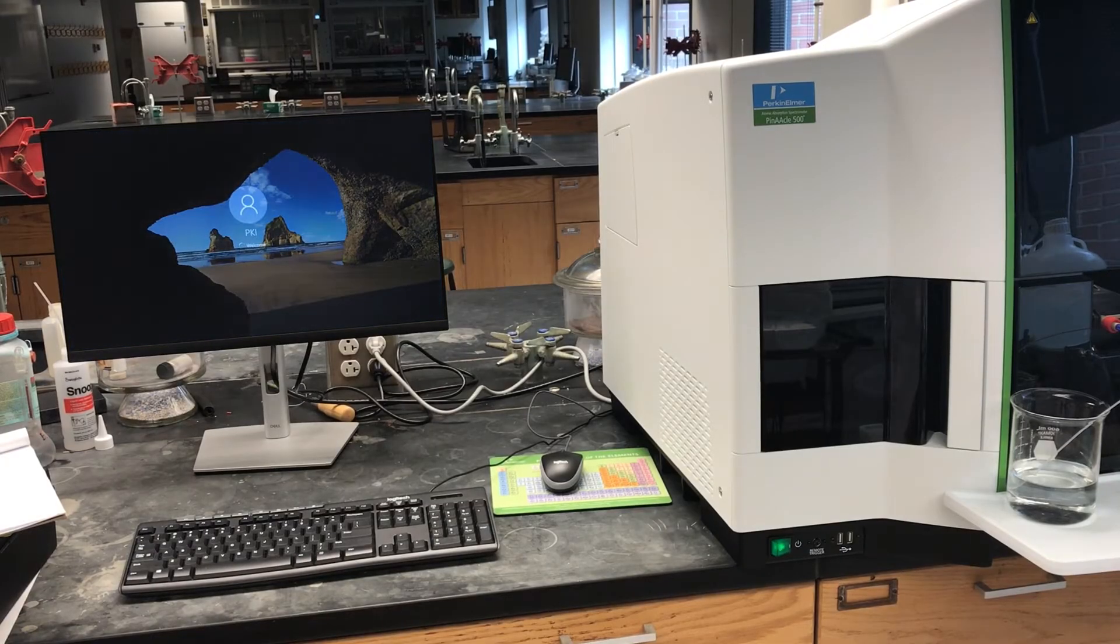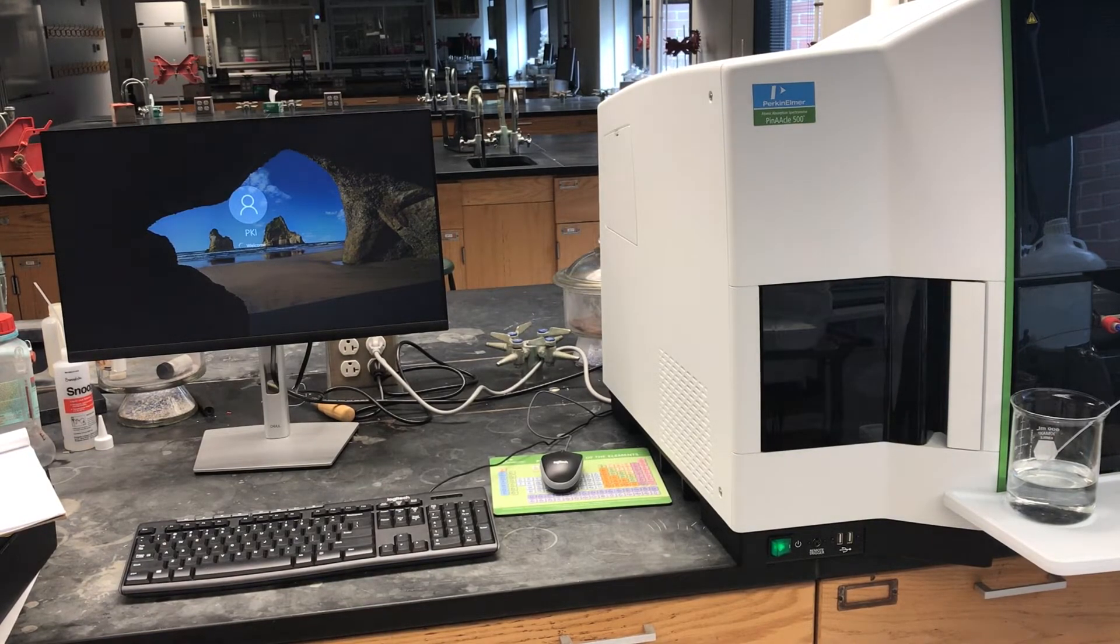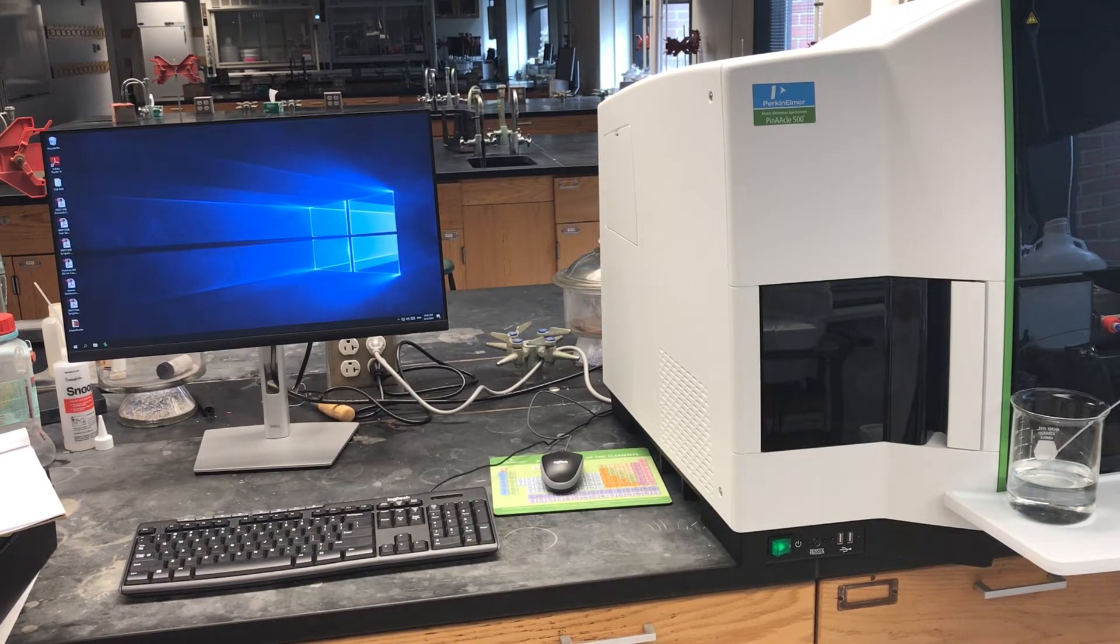This will then start the computer to which the instrument is connected, which is built inside the spectrometer. It will start up the computer, and then you can start up the Syngistix software.